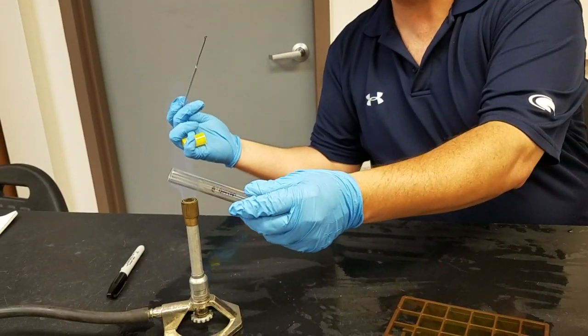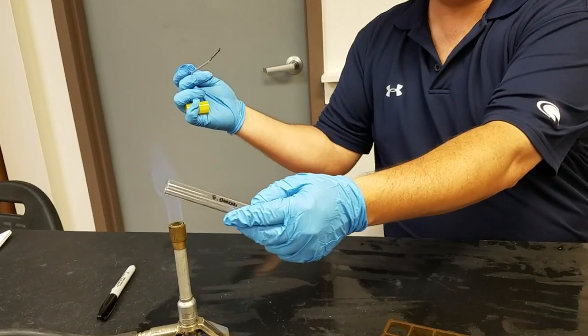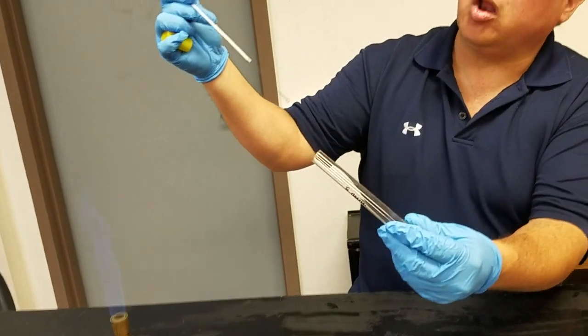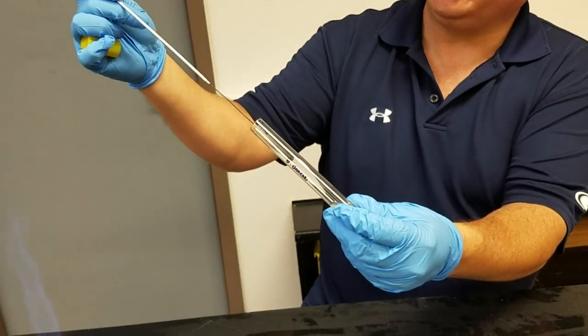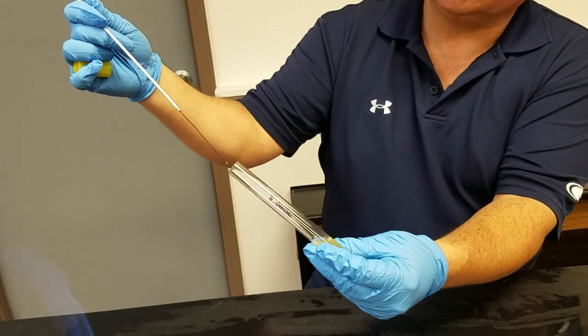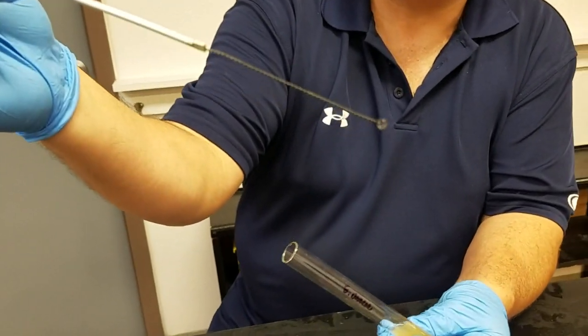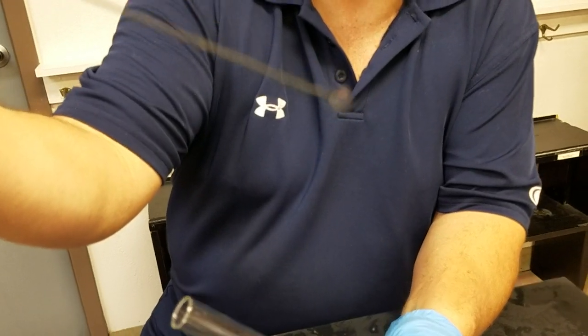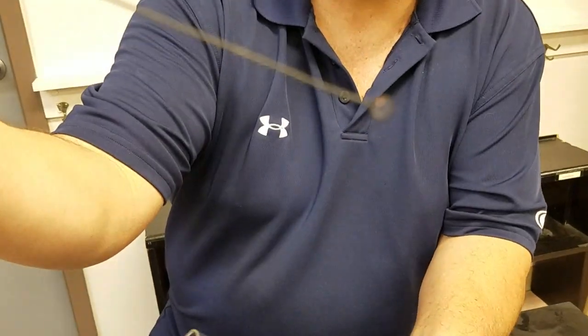Then I'm going to take that loop and put it into the culture, give a little shake, and pull out so you can see I have captured one drop of the suspension.